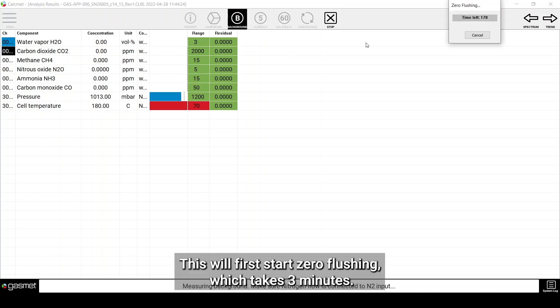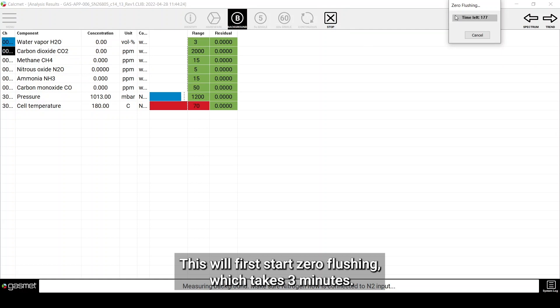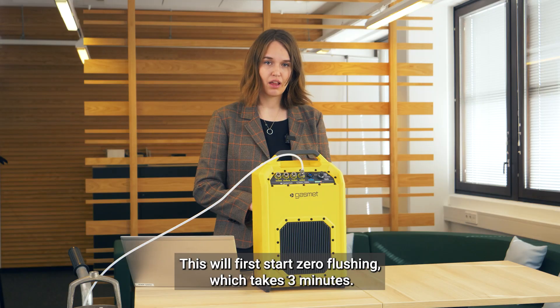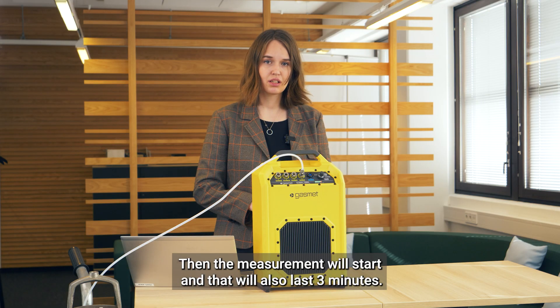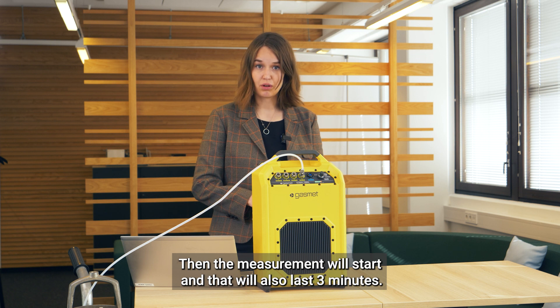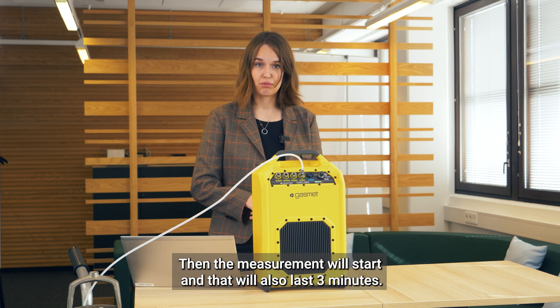This will first start zero flushing, which takes 3 minutes. Then the measurement will start, and that will also last 3 minutes.